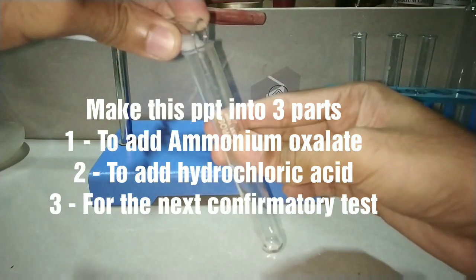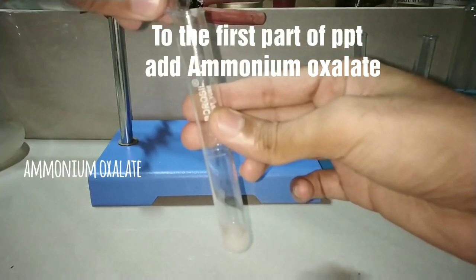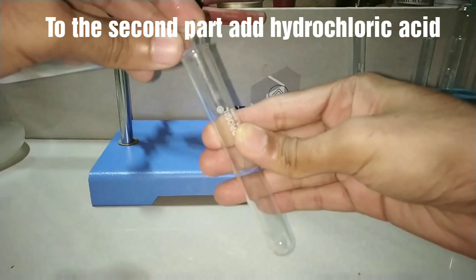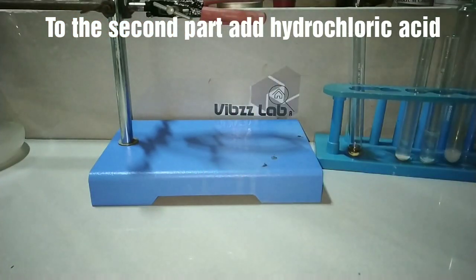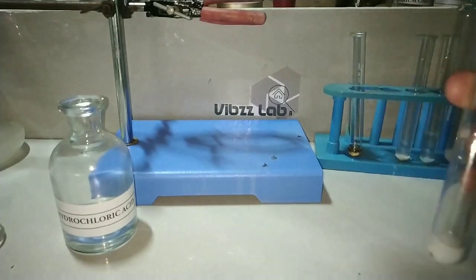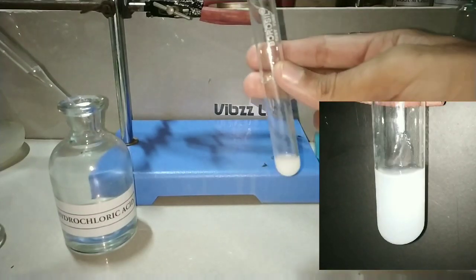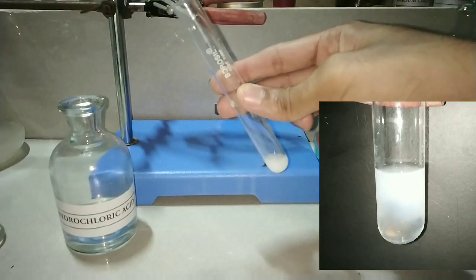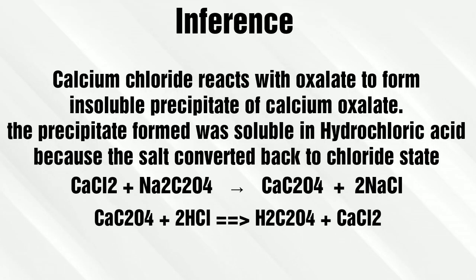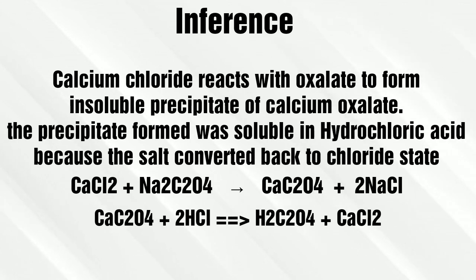To the first part, we will be adding ammonium oxalate solution to check for solubility, and you can observe that the precipitate persists. To the second part, we will be adding hydrochloric acid. On adding hydrochloric acid, you can observe that the precipitate is dissolving and the solution is colorless. Calcium chloride reacts with the oxalate salt to produce the insoluble precipitate of calcium oxalate, which becomes soluble on adding hydrochloric acid. The third part is reserved for the second confirmatory test.